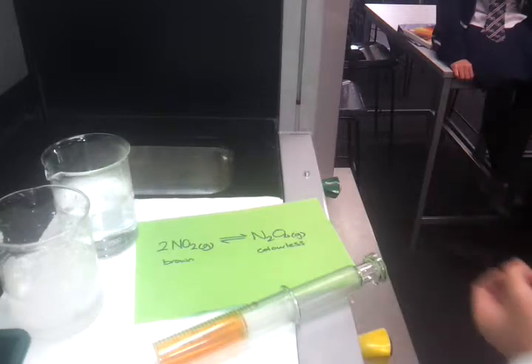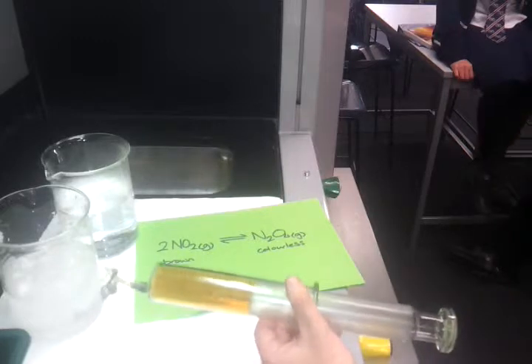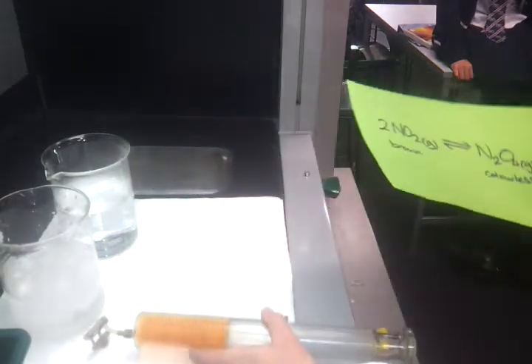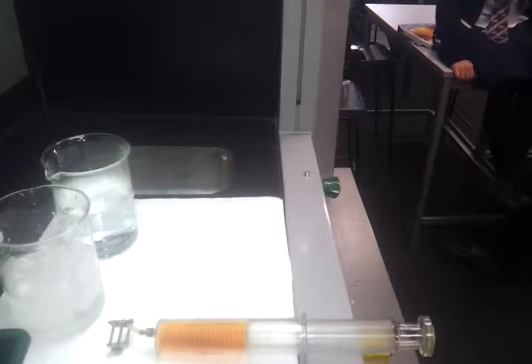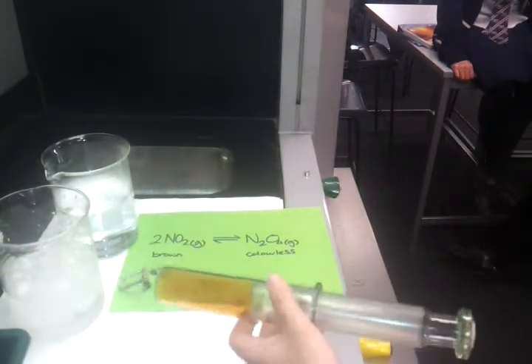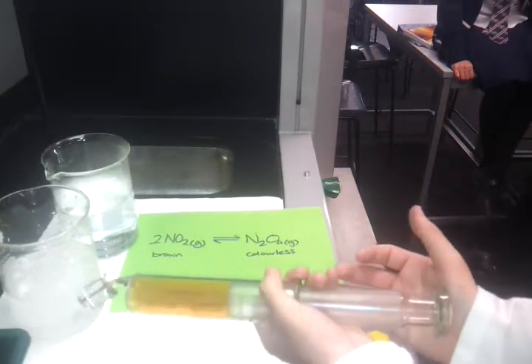One of the best ways to do this with things that are all gases is to play with the pressure. If I apply more pressure to this, the particles will get closer together, which makes it look darker. But if I hold that pressure in, that colour will start to go towards the one with fewer gas particles. In my equation, there's two gas particles as reagents and one gas particle as a product. So it's going to favour the side that has fewer gas particles if I increase the pressure. Now remember, it will get darker first because the particles are closer together. So let's have a look at that first on the video and then I'll show you.